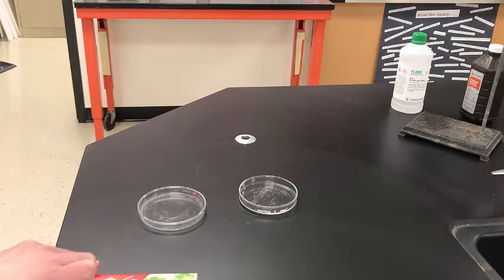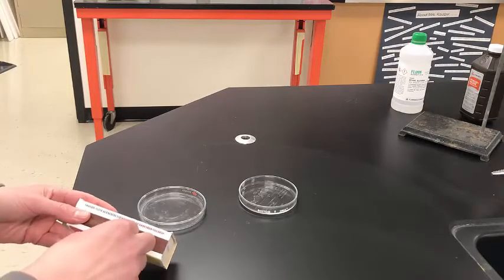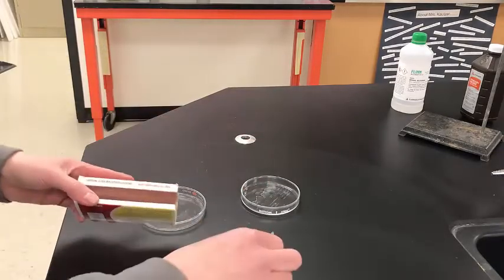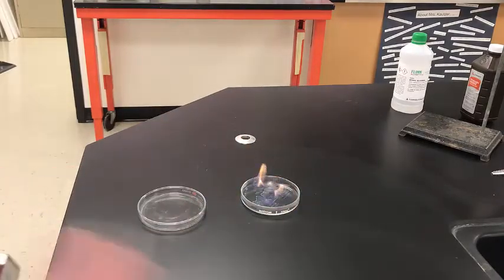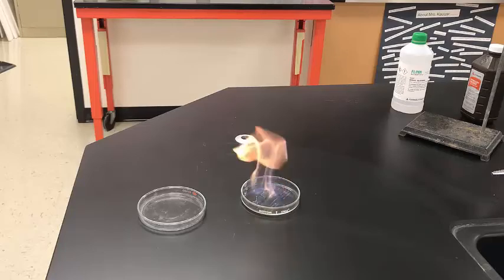So what we're going to do is observe what happens when a little bit of energy is given to the ethanol and the oxygen. So the ethanol is in this petri dish. Oxygen is just in the air all around us. Okay. So you can see some clear signs of chemical reactions going on there. And this, of course, is one that's burning, so we should pretty easily be able to figure out what kind of reaction that is. Okay.